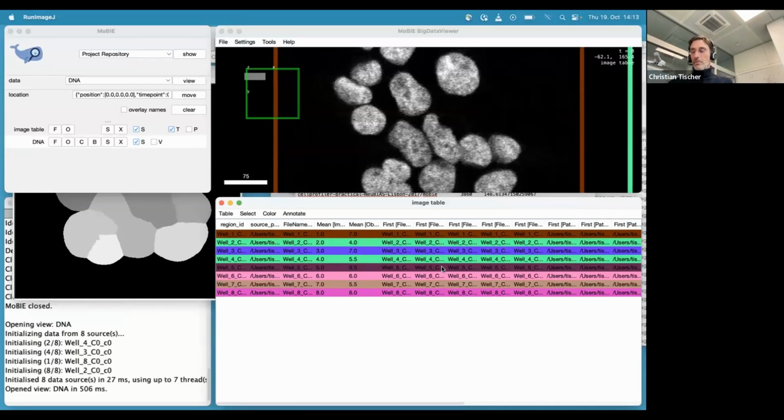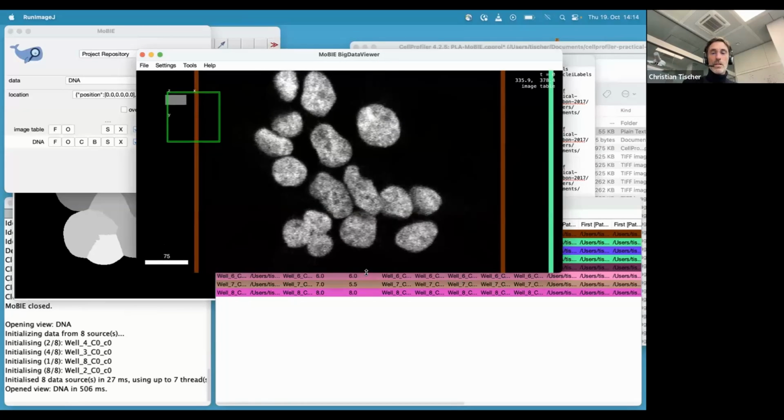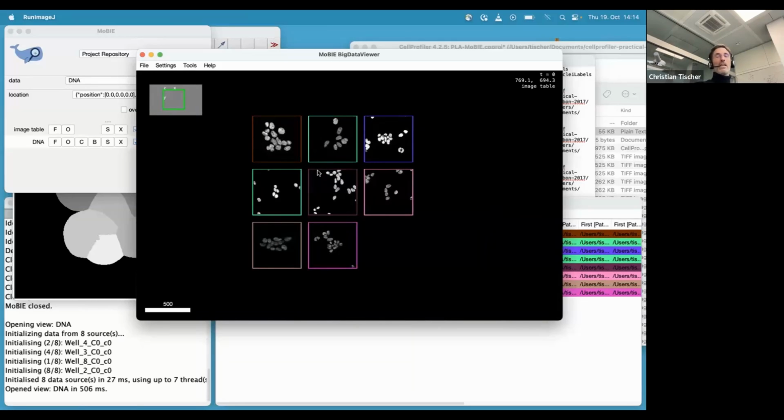MoBIE will open. And okay, so then the first thing is actually what you see, I will make this a bit bigger. So this is just a standard BigDataViewer window that you see. It opens all the images at once, and this scales quite well.